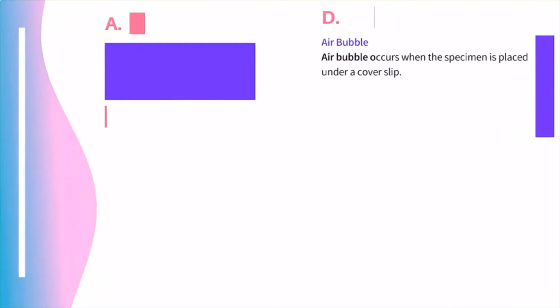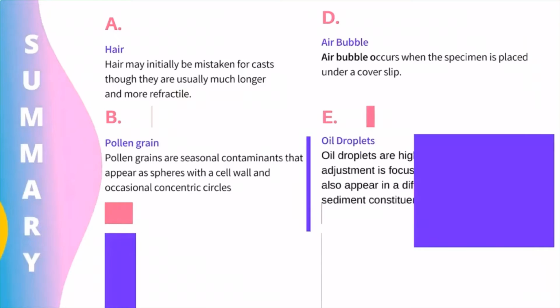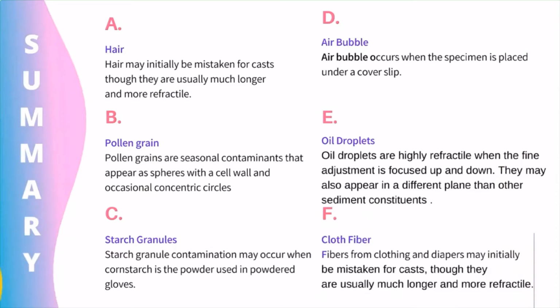Here I made a summary about the aforementioned artifacts. So the first one is hair. It may initially be mistaken for casts, though they are usually much longer and more refractile. The next one is pollen grains, which are seasonal contaminants that appear as spheres with a cell wall and occasional concentric circles. Third one is starch granule contamination.